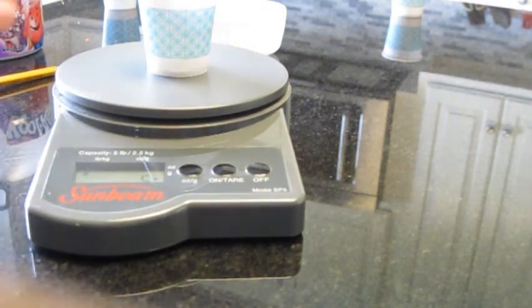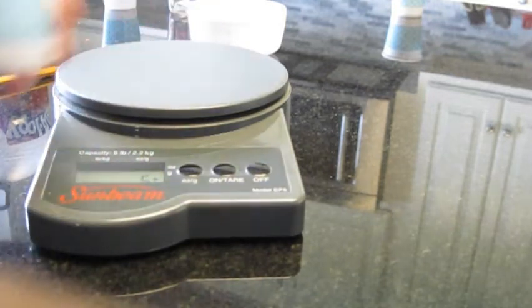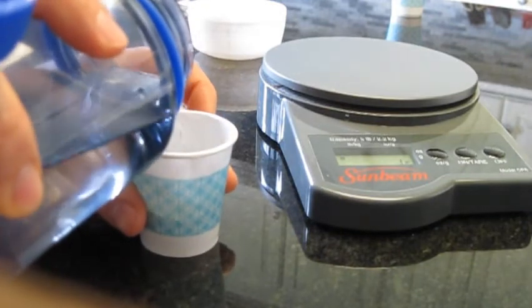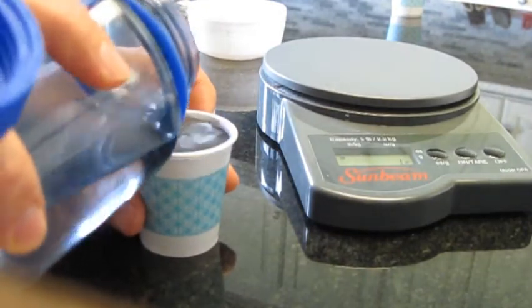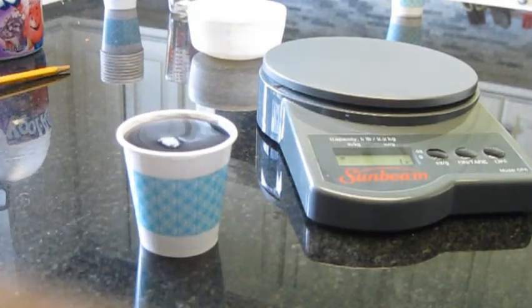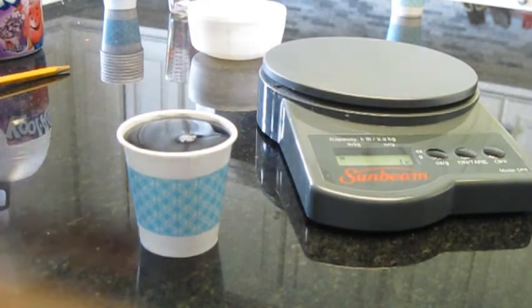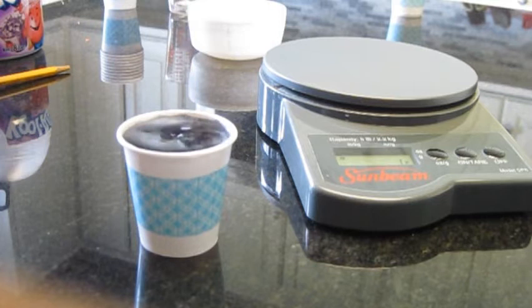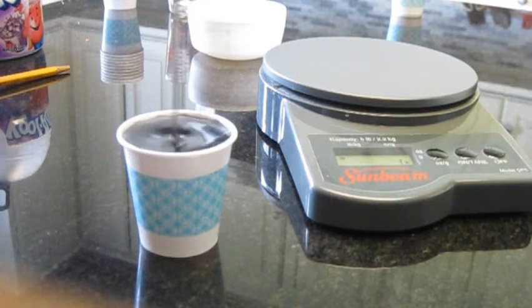The important thing is that you put the solute in before you put the solvent. So after that, we can take it off the scale, because that's all we needed, and we're going to fill this up to the top of that cup. That's about 80 milliliters at the top. Don't overflow. And then stir, stir, stir until all of that solute is dissolved. For some of these concentrations, this might take a little while.